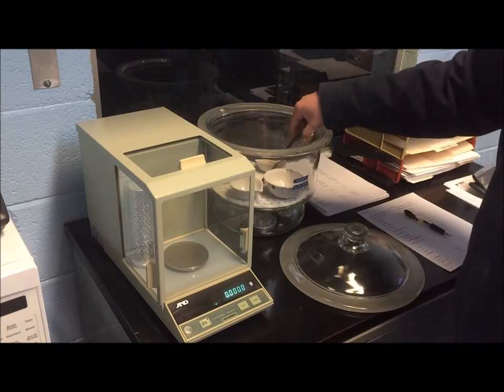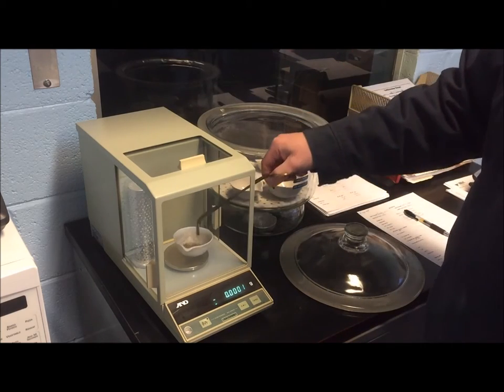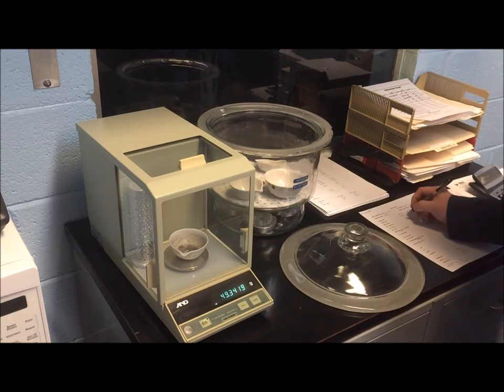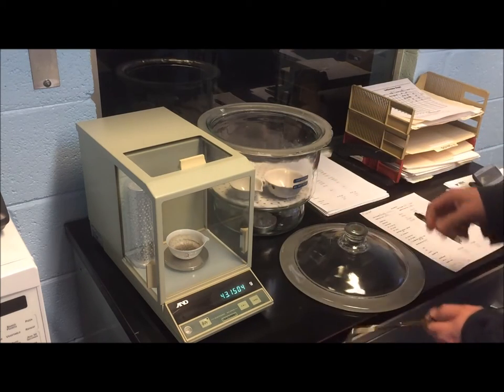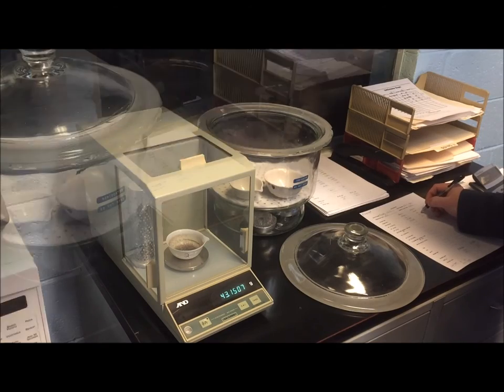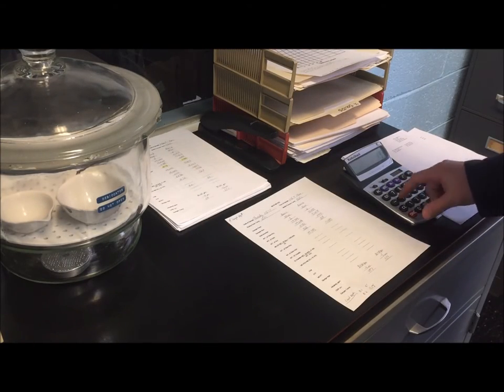After cooling, the dry samples can now be weighed and recorded. Now the math must be done to find our mixed liquor suspended solids number in milligrams per liter.